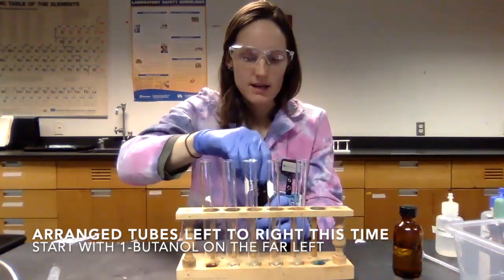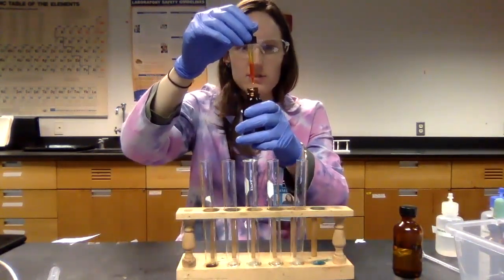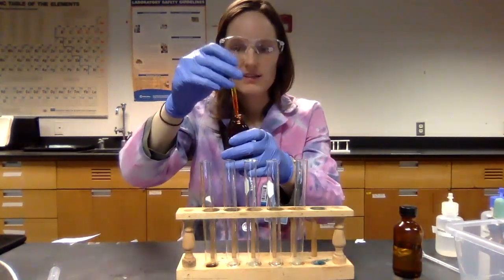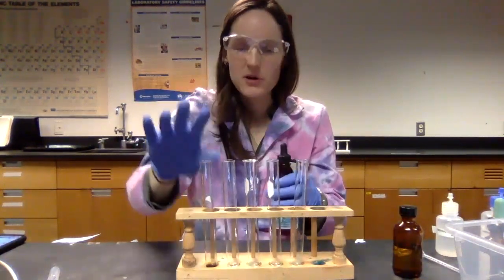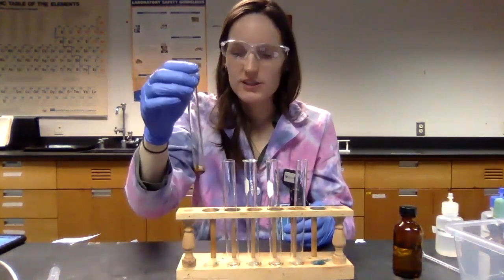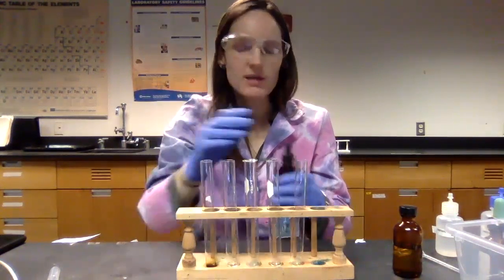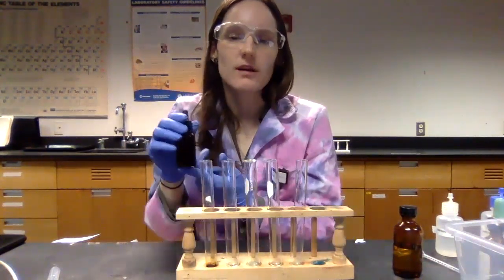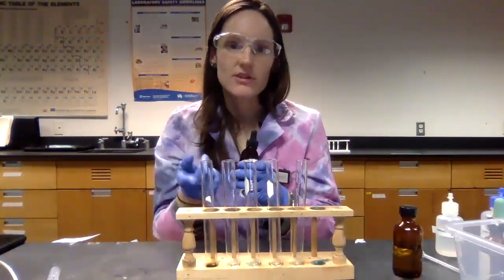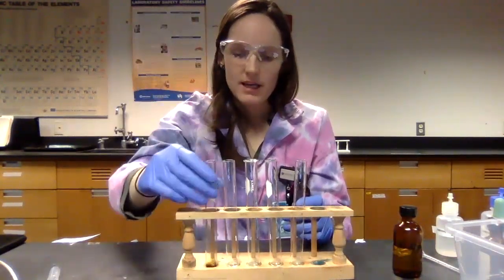And my chromic acid solution is this burnt orange color, which looks correct, but hopefully it works. I only added 1 drop to this test tube because this is the second time I'm doing this, and it became very, very dark. I don't know if maybe I used a sulfuric acid solution that was too concentrated, or maybe this is just fresh and these are much older. I'm not sure. So I ended up just using 1 drop in this test tube.